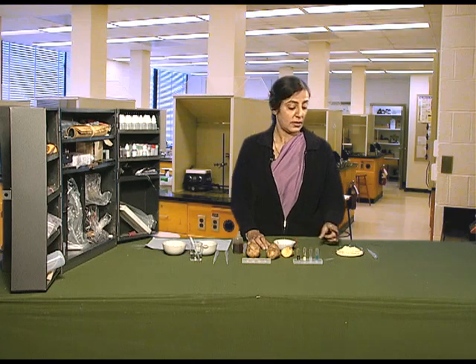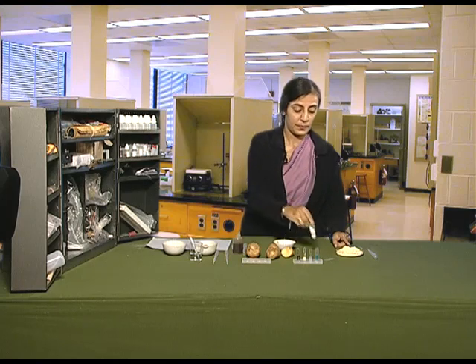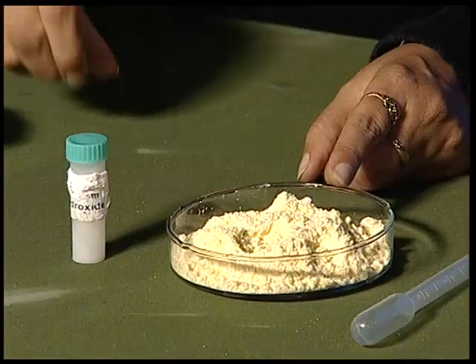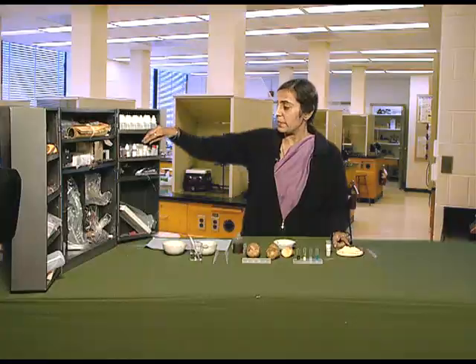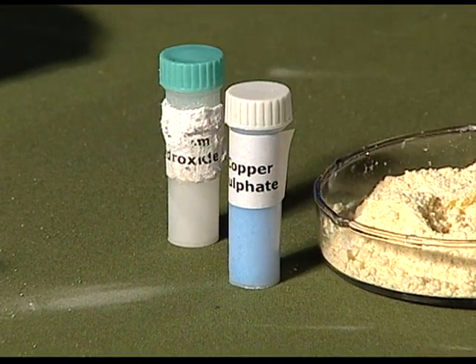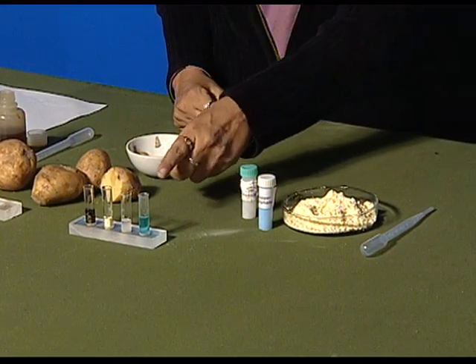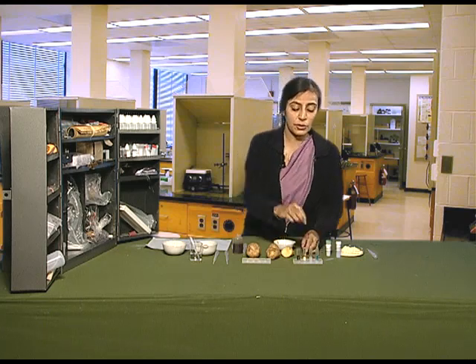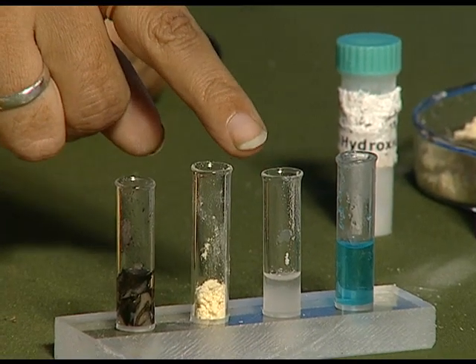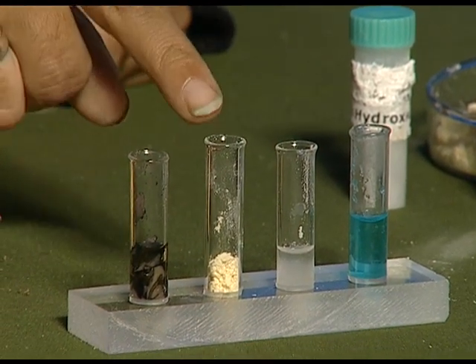Now, to test the presence of proteins in our food, we need powdered dal, caustic soda, copper sulphate, a dropper, and a test tube. We take a test tube and add copper sulphate solution to it, then sodium hydroxide or caustic soda, and powdered dal.